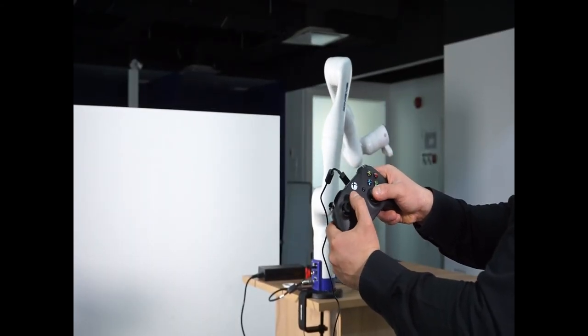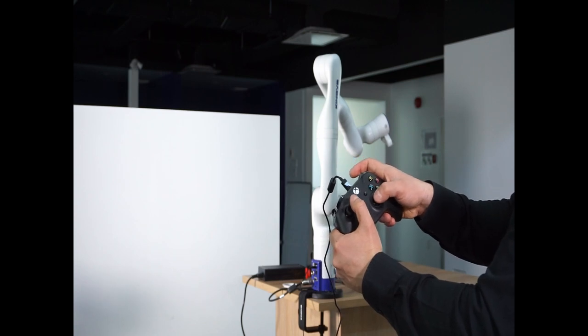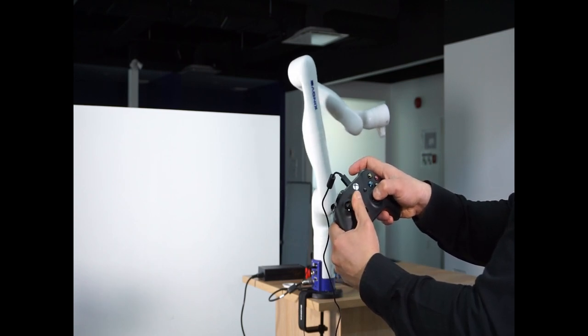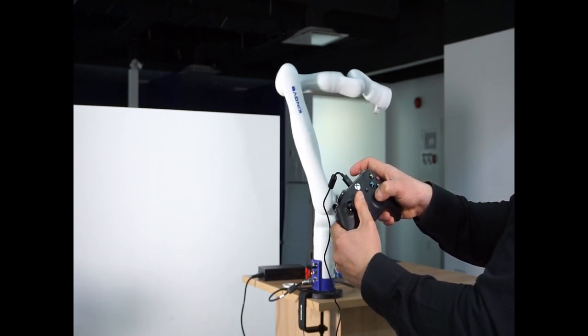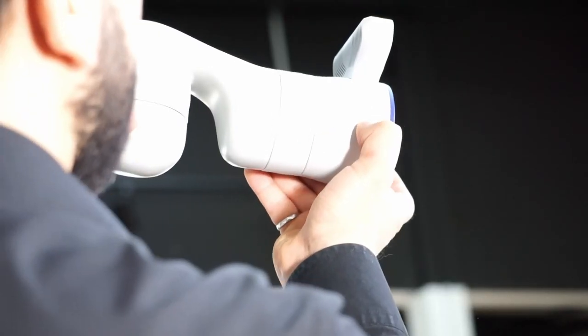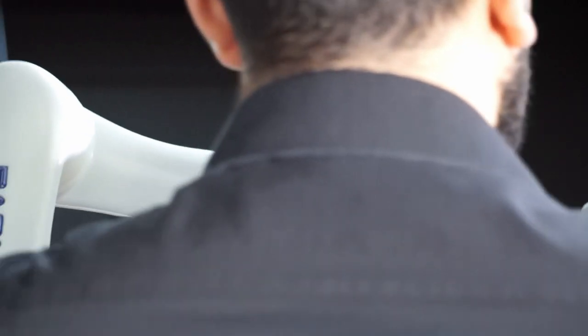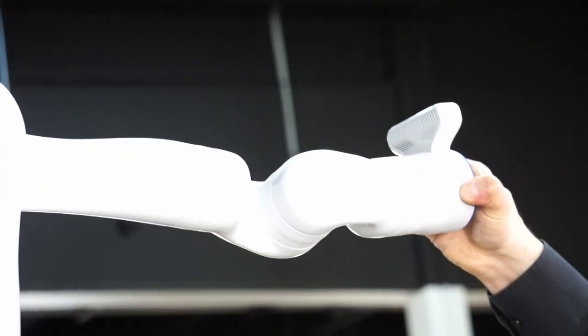According to the type of your robot, 6 or 7 degrees of freedom, you can use different control modes. You can also control your robot by hand using the admittance buttons located on the wrist.